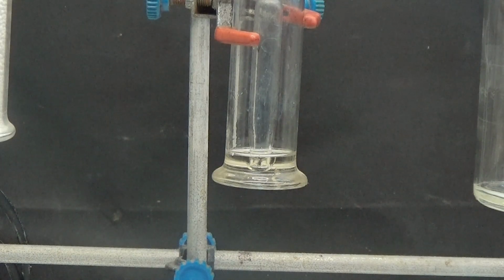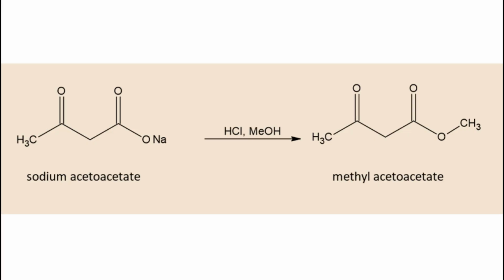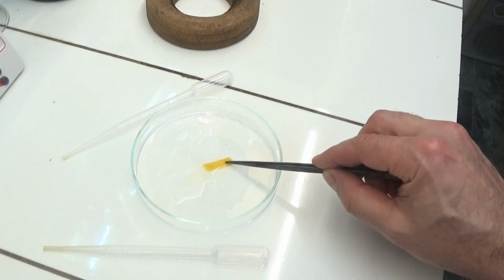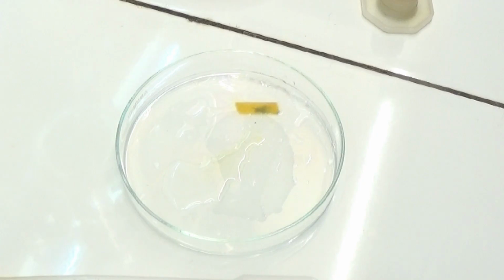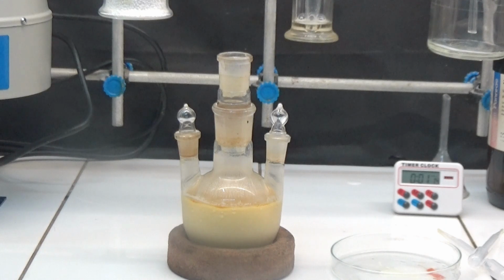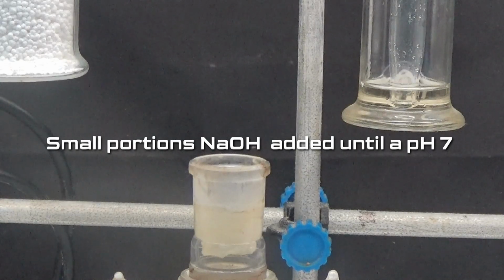When the gas is passed through the flask containing the sodium salt of acetoacetate, the color of the reaction is observed to be less dark. This occurs due to the formation of sodium chloride and methyl acetoacetate. Measure the pH by placing a drop of the reaction on a wet piece of indicator paper. When the reaction with the indicator paper is acidic, the addition of gas is stopped. If the pH is too low, small portions of sodium hydroxide can be added until a pH 7 is obtained.